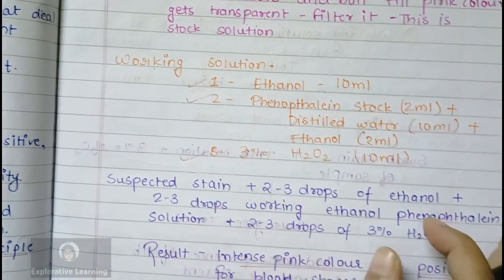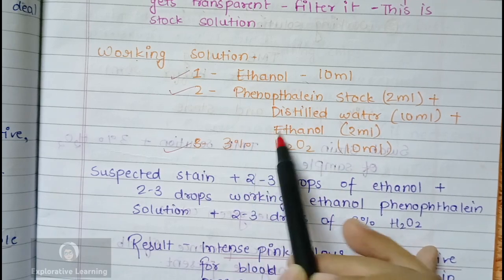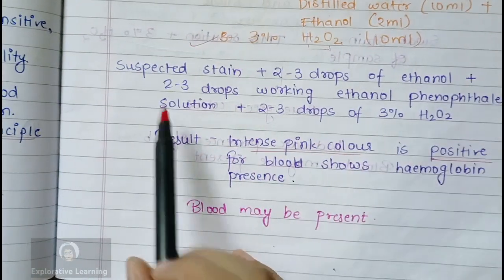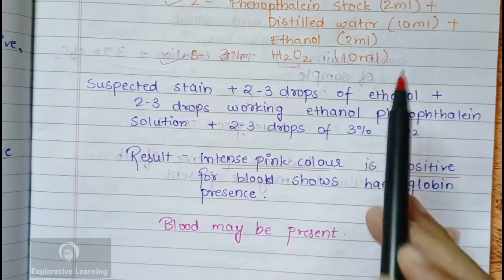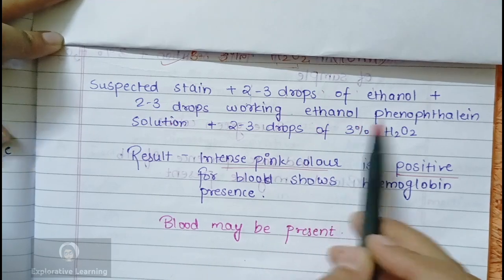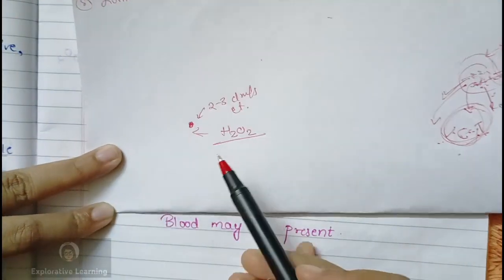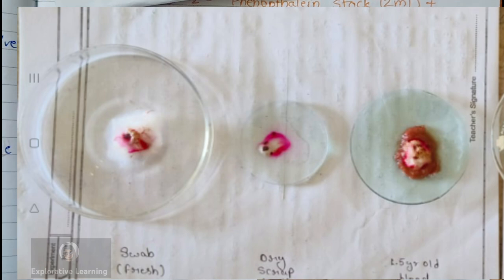For the working solution, you need 10 ml of ethanol, 2 ml of the phenolphthalein stock solution prepared above, 10 ml of distilled water, 2 ml of ethanol, and 3% hydrogen peroxide which acts as an oxidant. To carry out the test: take the suspected stain, add 2 to 3 drops of ethanol, then add 2 to 3 drops of the working phenolphthalein solution, followed by 3% H₂O₂. Wait for some time — an intense pink color gives a positive result for blood.